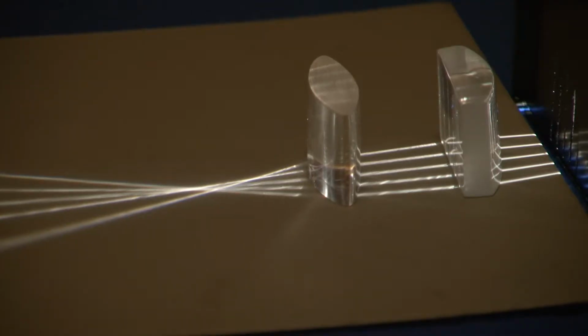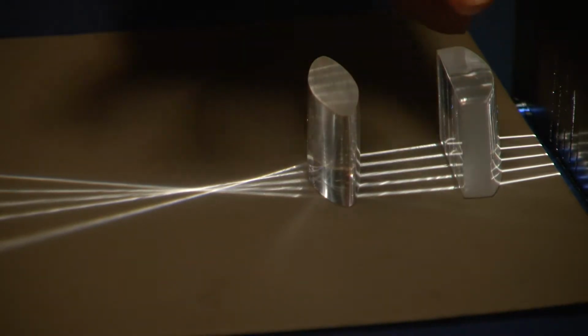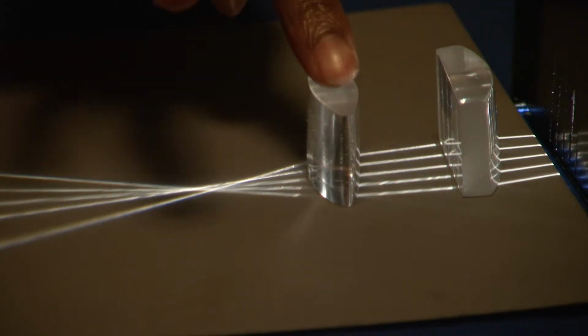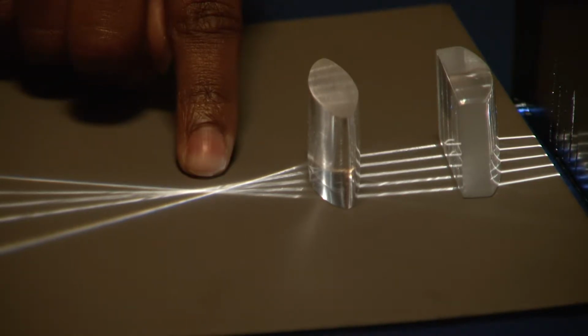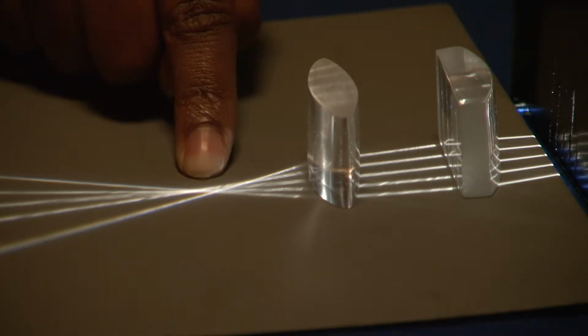Using the light box, I will demonstrate how light is refracted onto the retina. When light strikes the cornea, it bends and converges on the back of the eye. The lens fine focuses the light onto the retina. We will see the lens in a few moments. The cornea of the eye is usually transparent.